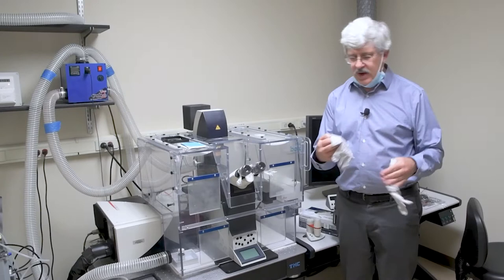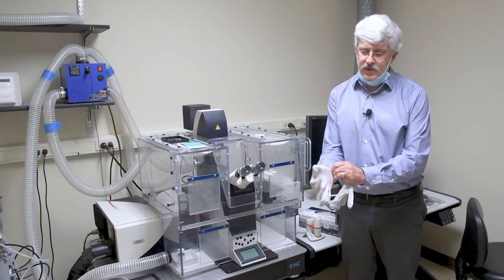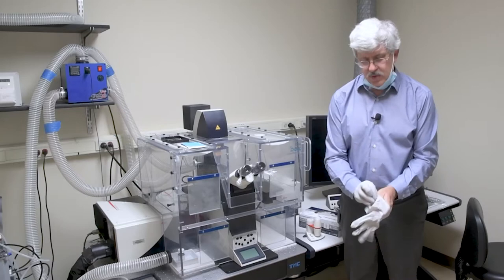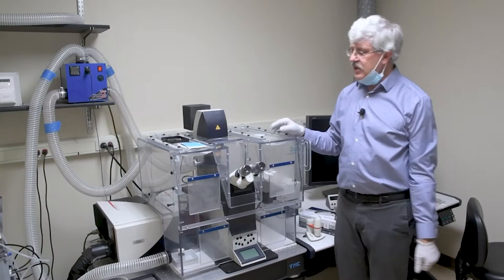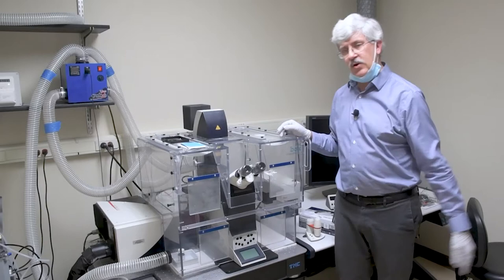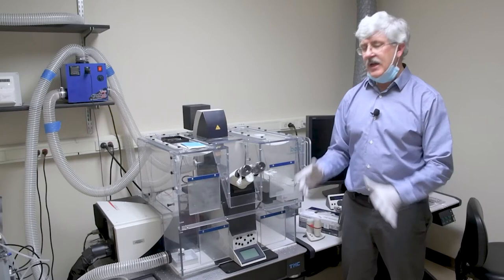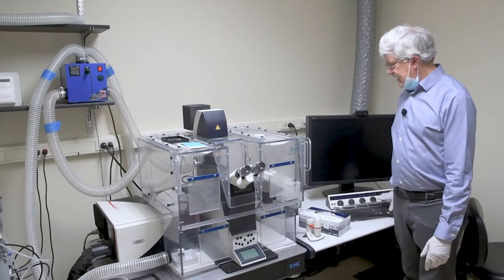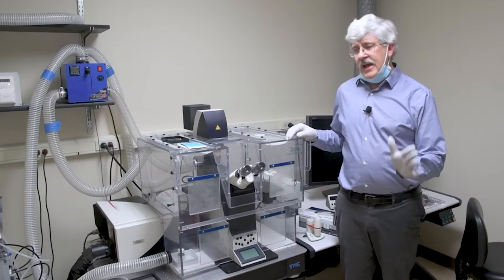In addition, you must be wearing a fresh pair of gloves. I don't mean a pair you were wearing back in the lab before you came down here. I mean a fresh pair that you either brought with you or you could be getting from us. You'll also notice there's some other safety things on the microscope including the plastic over the oculars, touch screen items, keyboards, mouse, and other commonly touched areas.